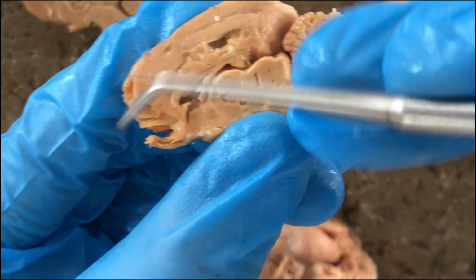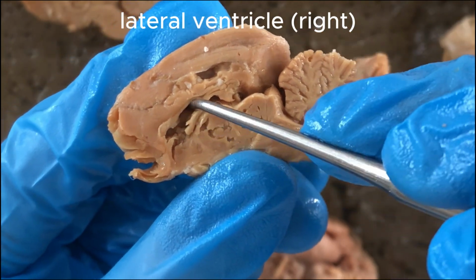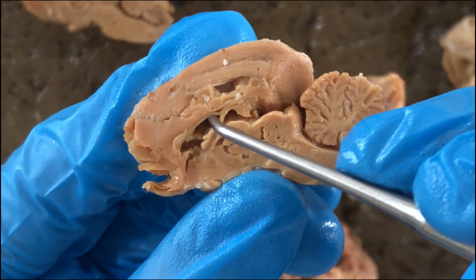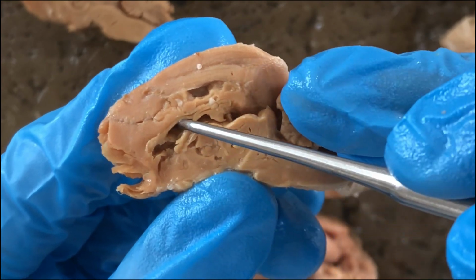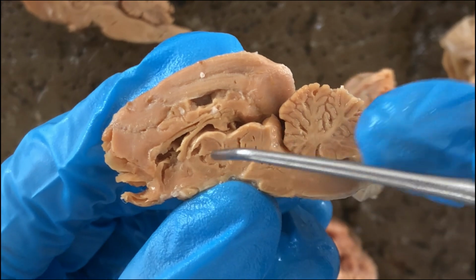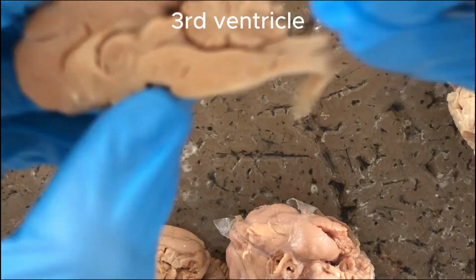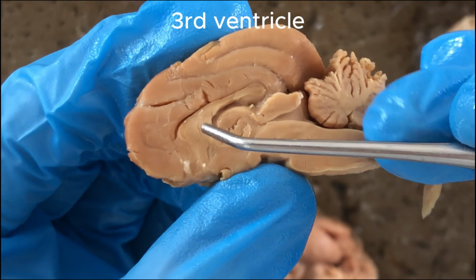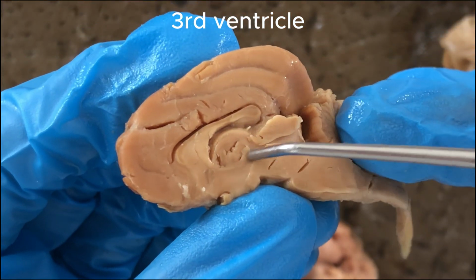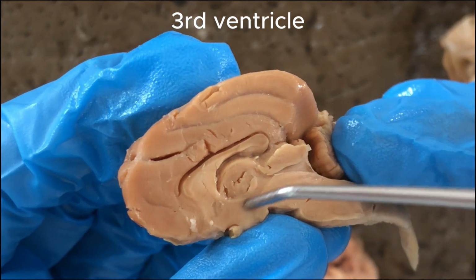you'll see inside the cavity of the lateral ventricle. So there are 4 ventricles or cavities in the brain, the 2 lateral ventricles, and then the third ventricle here. So the lateral ventricle is inside there, covered by the septum pellucidum. This is the third ventricle, located in the diencephalon.